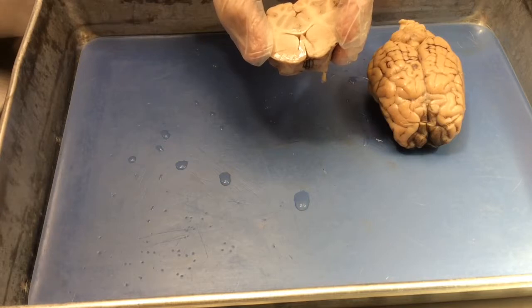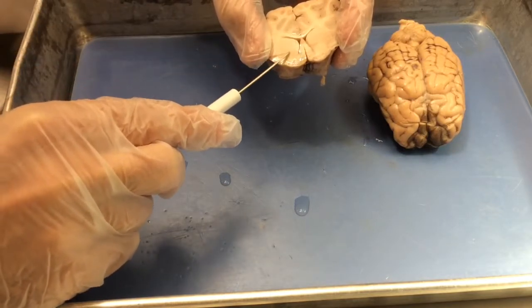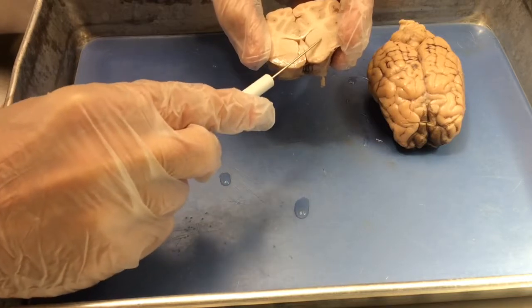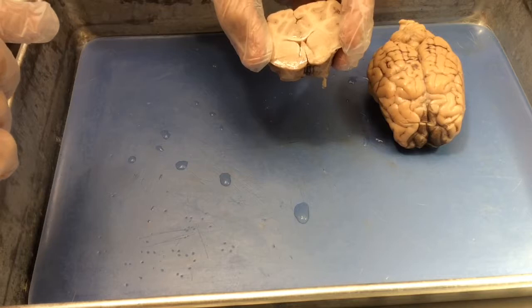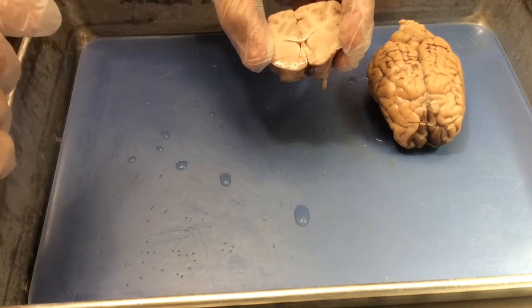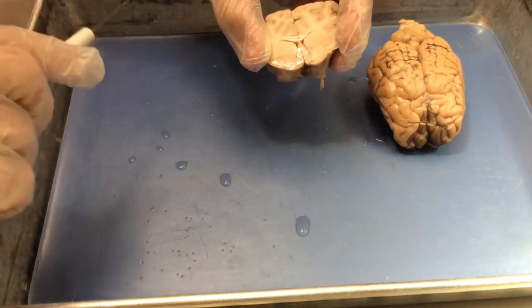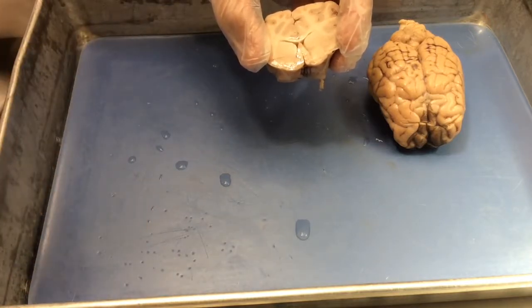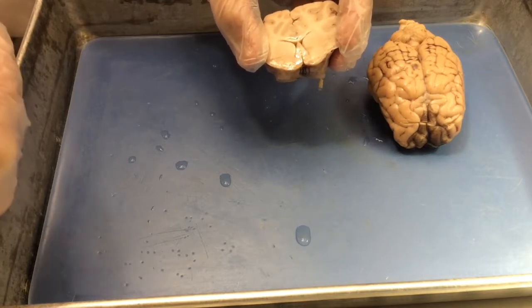On sections with higher contrast, you can often see white matter running through the basal ganglia. This structure is called the internal capsule, and more specifically, it's axons of neurons of motor cortex that are running through the forebrain and eventually through the rest of the brain down to spinal cord to contribute to control of movement.